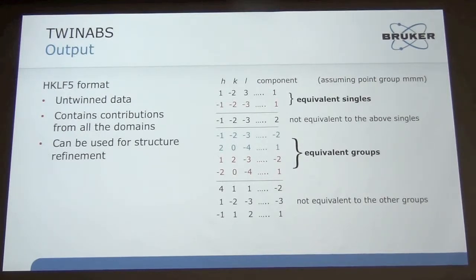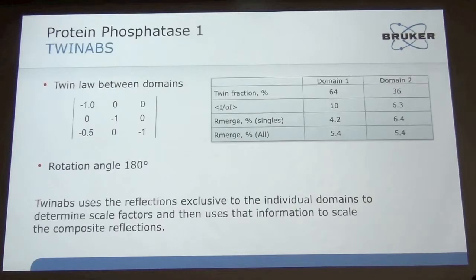So he usually solves a structure, refines it with the HKLF4, the detwinned data, and then does a final refinement against the twin data. For the phosphatase 1, you see that this is the twin law between the domains. When I actually split the two, I got a twin fraction, one domain 64, the other 36%, and then splitting them, I get much better data.